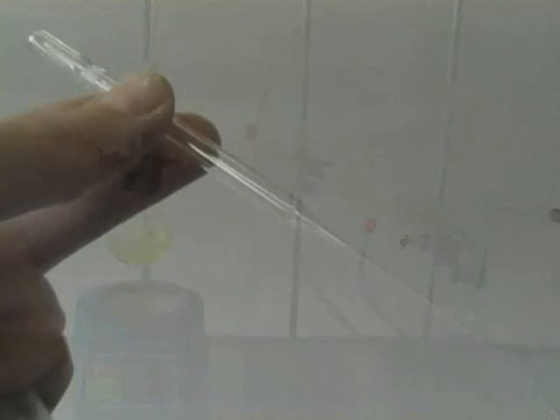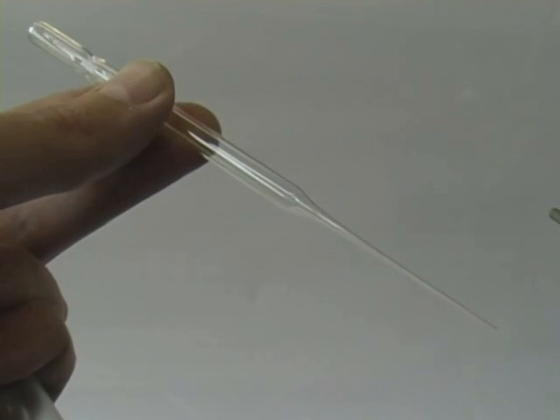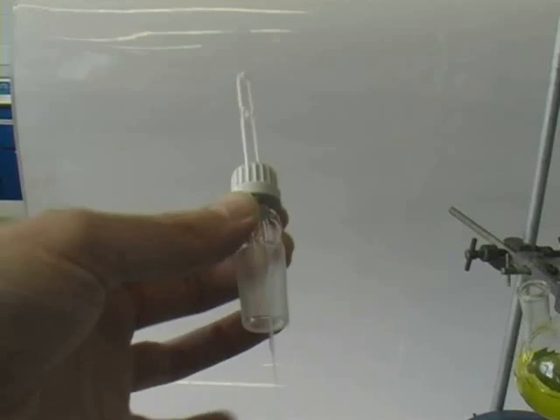In order to make our air bleed, we take a glass Pasteur pipette and heat the narrow end in a Bunsen flame until it softens. We can then pull on it to draw it out into a fine capillary. We then break this off at an appropriate point and house the pipette in a screw cap adapter as shown.